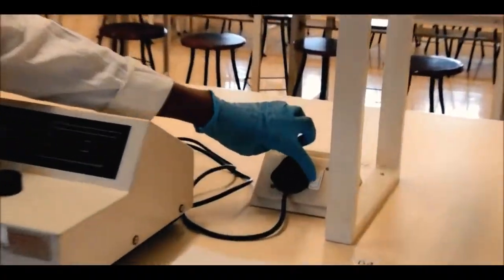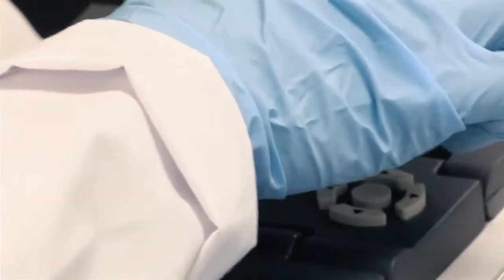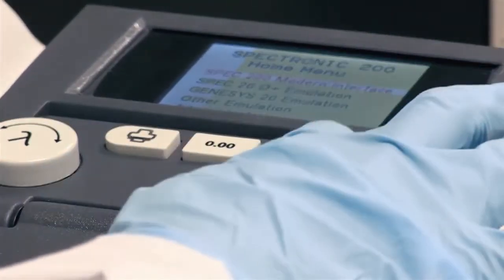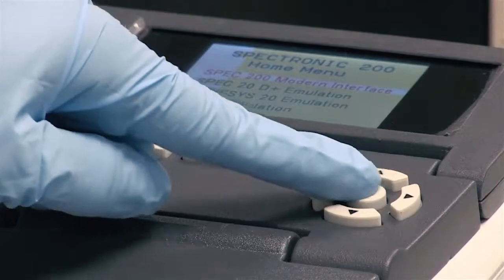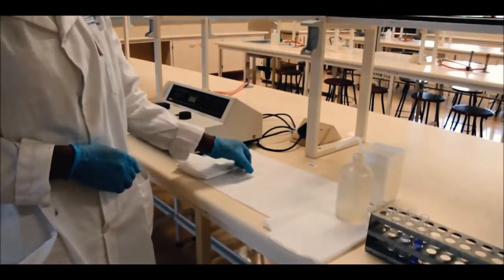How to use spectrophotometer: First, switch on the spectrophotometer. Next, set the spectrophotometer to the desired wavelength. Always ensure that your instrument is set to absorbency mode when reading absorbencies.